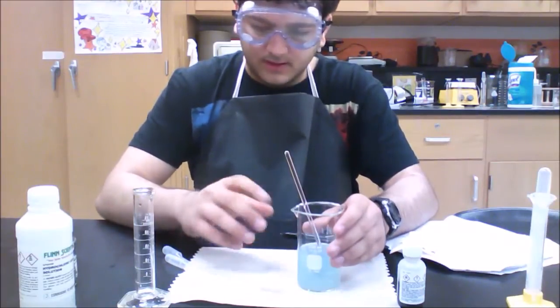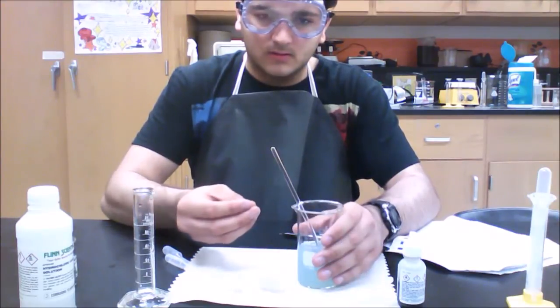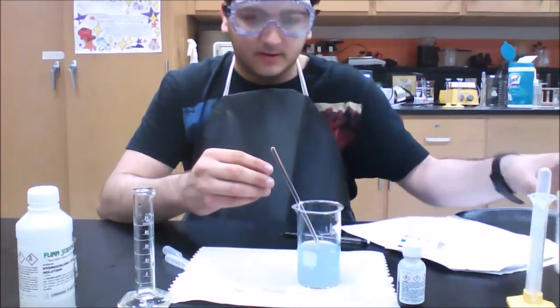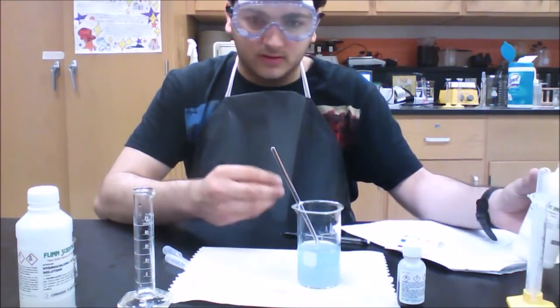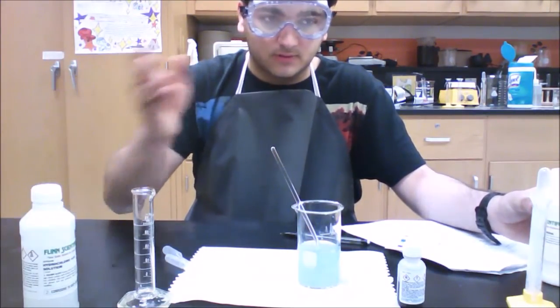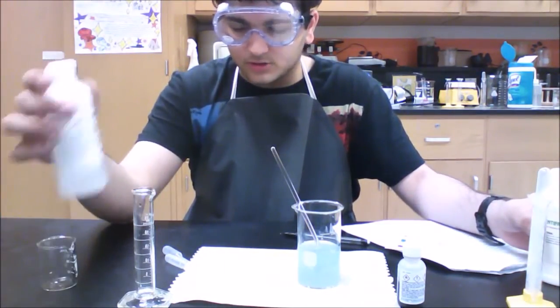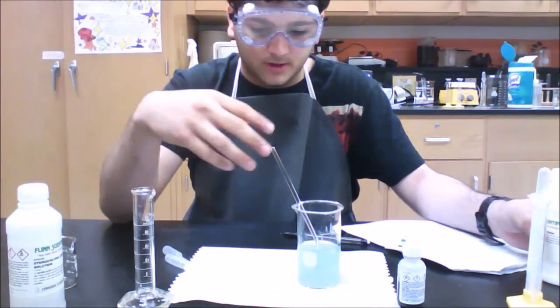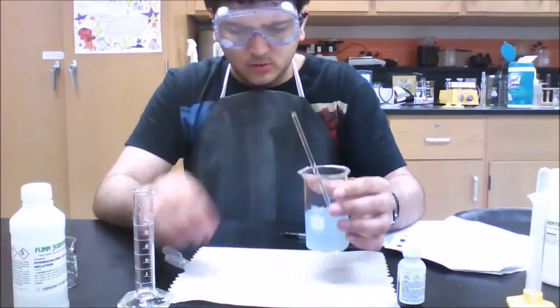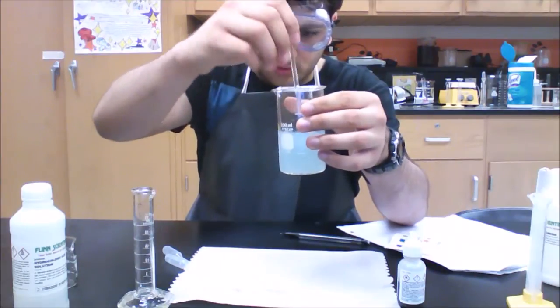Okay, so after you get your pH down to under 4, if you want to observe Le Chatelier's principle more, you can add some more milk of magnesia, because what milk of magnesia does is release hydroxide ions, which counteract the acid in the HCl, and that shifts your equilibrium and raises the pH closer to a more basic pH, because the acid is being negated by the base. So what I've done is added about 20 milliliters more of milk of magnesia, and as you can see, the color became more of a blue.